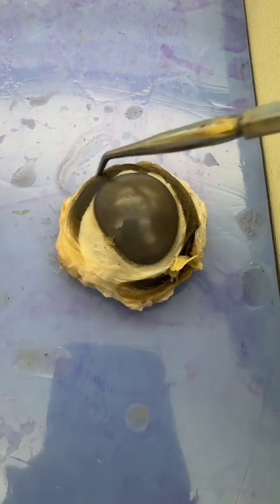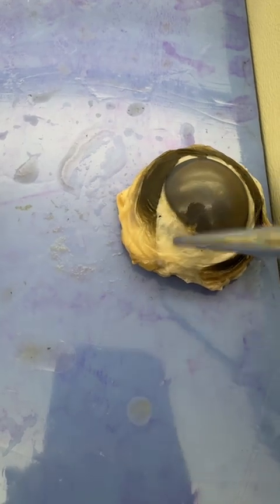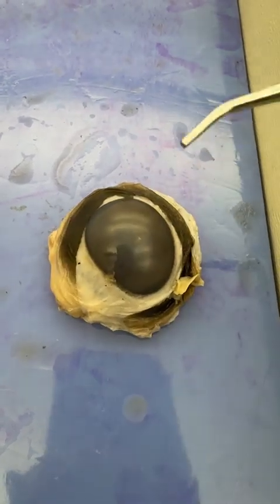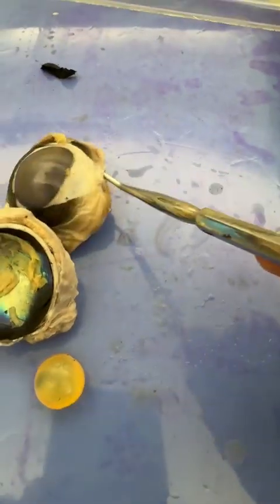There is this kind of flexible skin-like material all around it that's called bulbar conjunctiva. If you've ever gotten it infected, you've had a bulbar conjunctiva infection, it's conjunctivitis or pink eye.